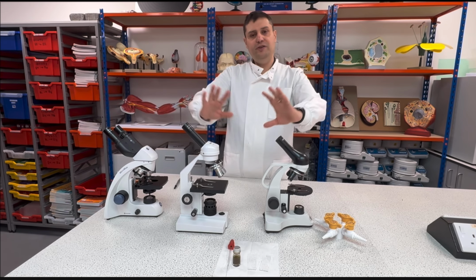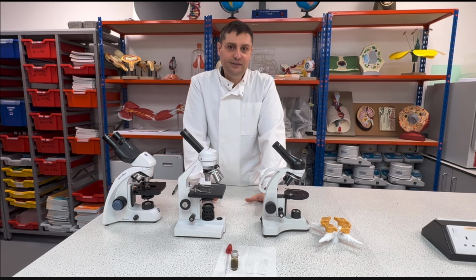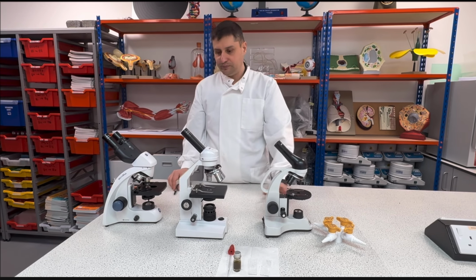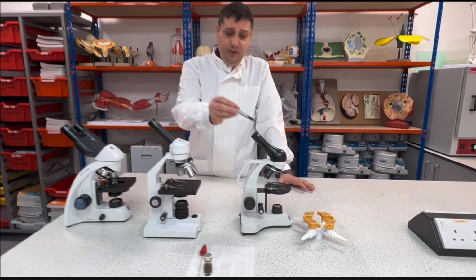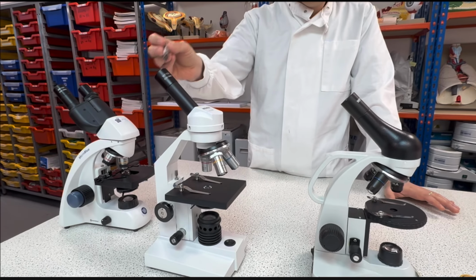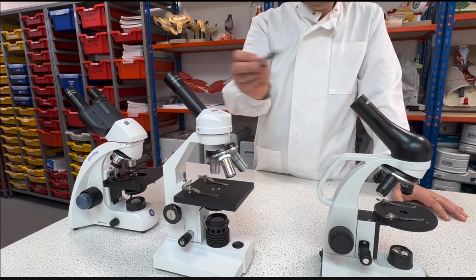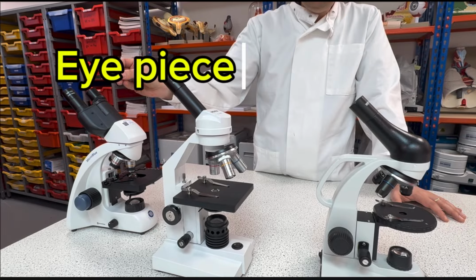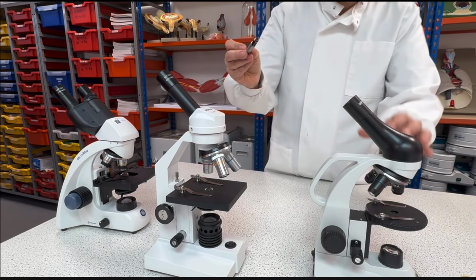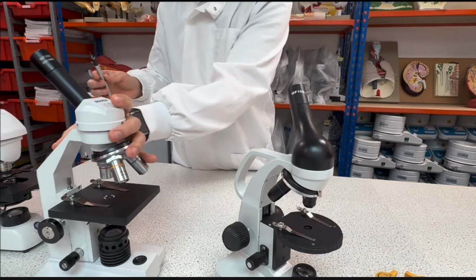First of all, let's learn the names of the parts of the microscope. Starting with this piece on the top where we see whatever we are checking. This is called the eyepieces. On top of the eyepieces you will see numbers.